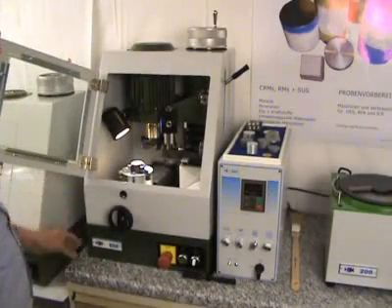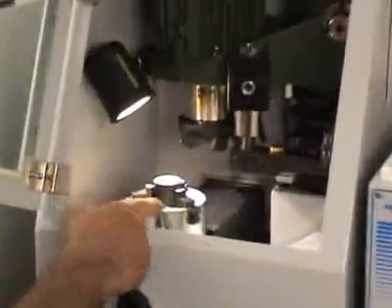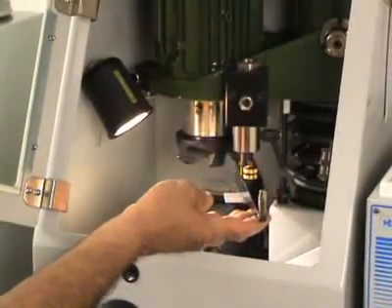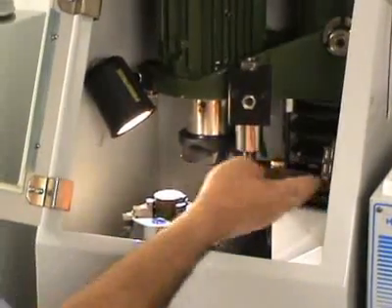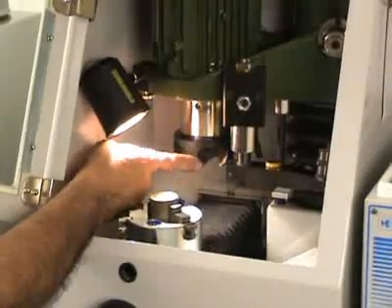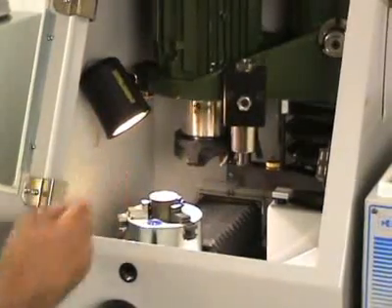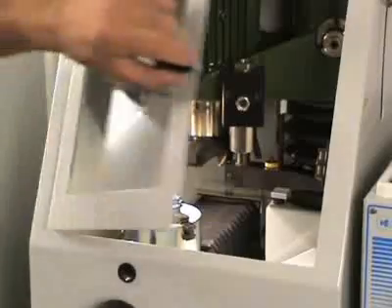The sample is fixed in a standard 3-point chuck. With a height measurement device, the cutting head is set on sample level indicated by a red LED. The standard cutting head has 5 turnable cutters.